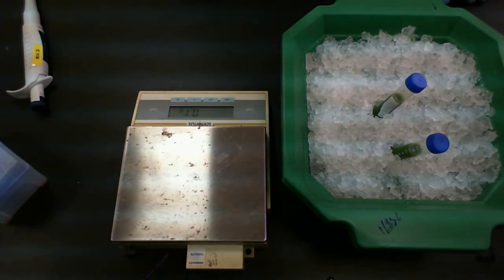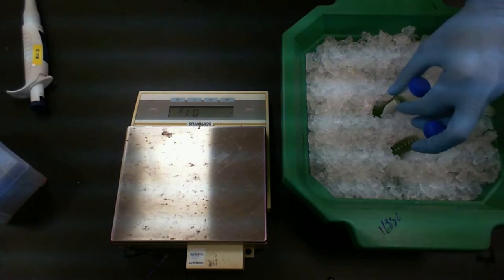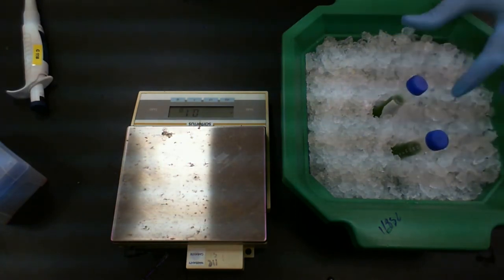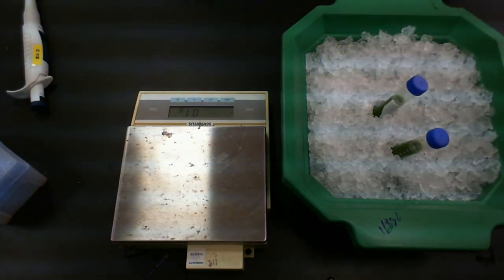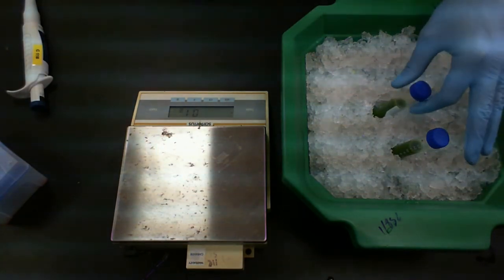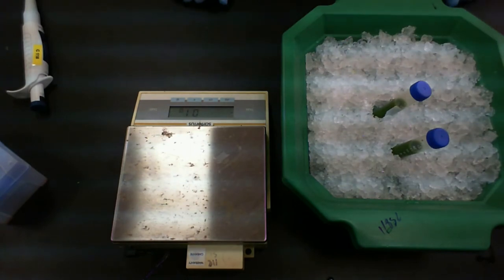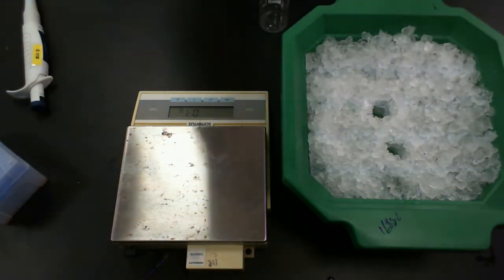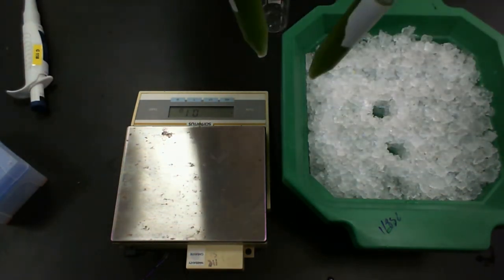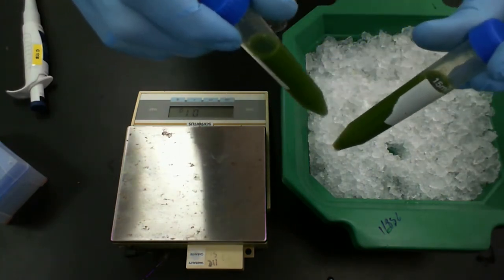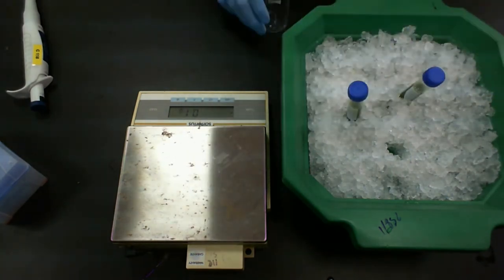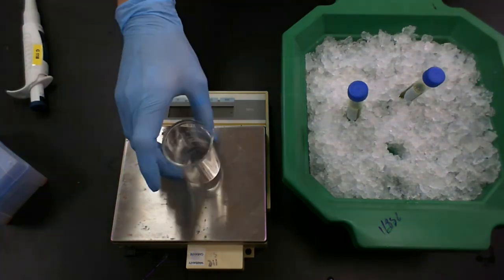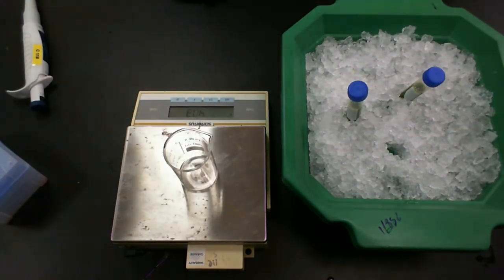So we now have two samples. I split up my homogenate into two tubes so that I could spin them in a centrifuge. Now, there's a bit of a problem. We have a volume of liquid. We're not quite sure what it was supposed to be. So I divided up roughly evenly between the two tubes, but they're about 11 milliliters, but I'm not sure exactly if they are balanced. So how do we balance these properly?